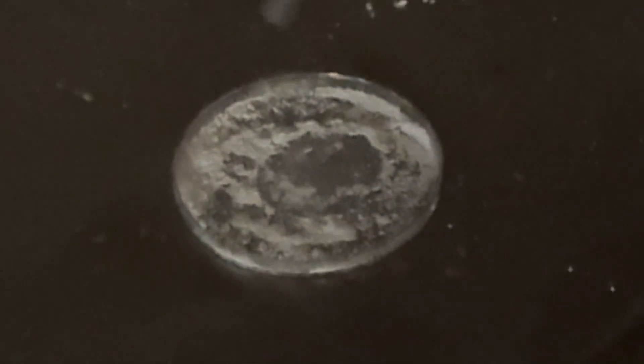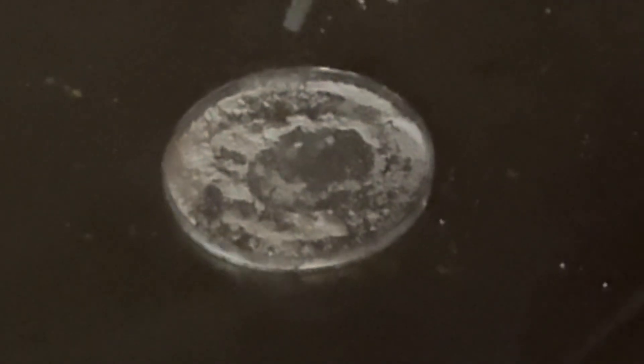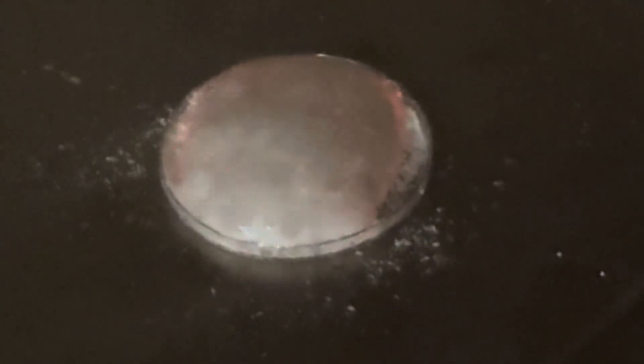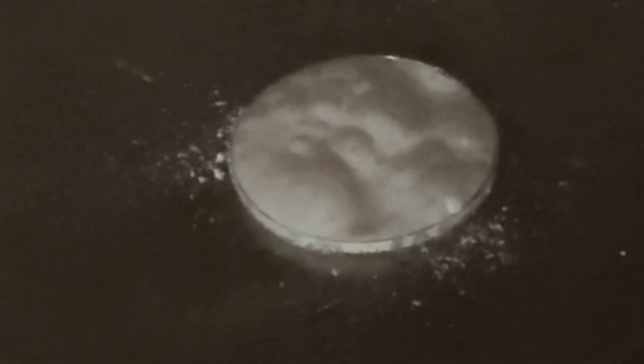This is ground up sodium dichlor with what we call in the science world a crap ton of 30% hydrogen peroxide. There we go. That was sick. Did you see that? Okay, that was actually cool. That one actually worked.